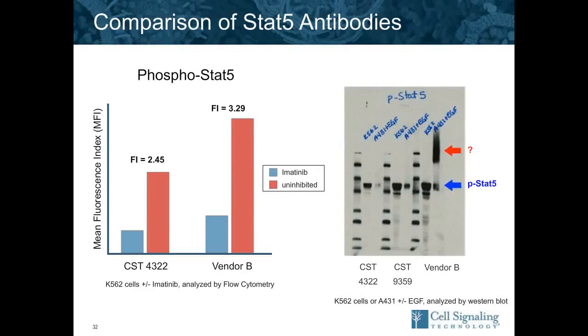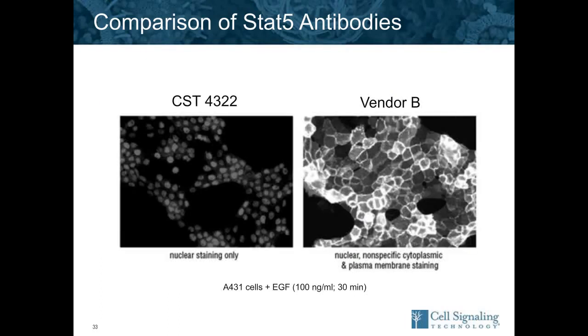Another example here started in our flow cytometry lab, where we were looking at two different antibodies for phospho-STAT5, and we saw a much greater signal with a competitor antibody. And so we started to look into that and ran some Western blots, as you see on the right, and note that very large high molecular weight band. This is typically seen where we see receptor tyrosine kinases. And so then we took cells and treated them with EGF.